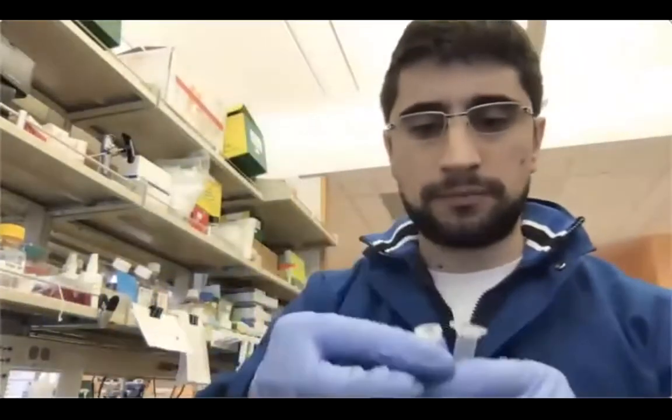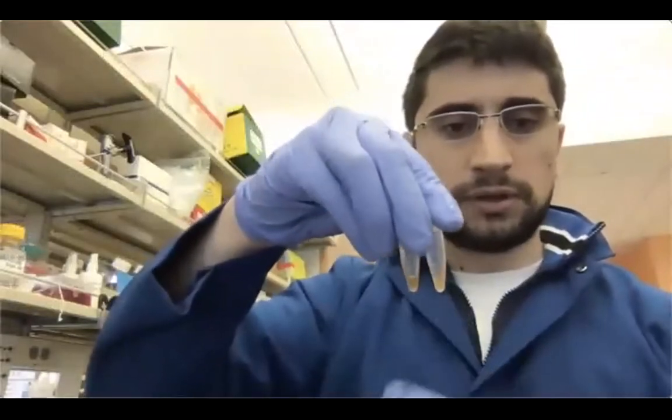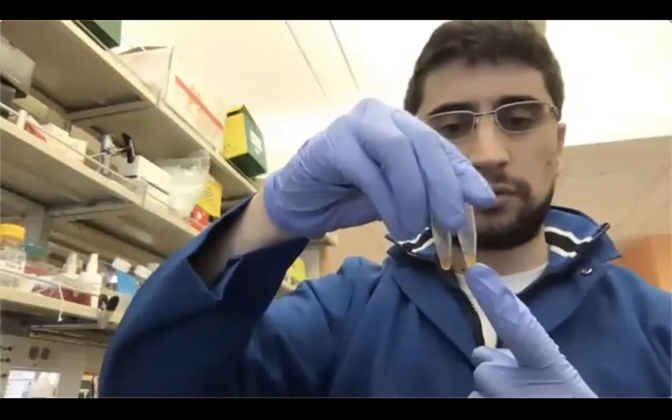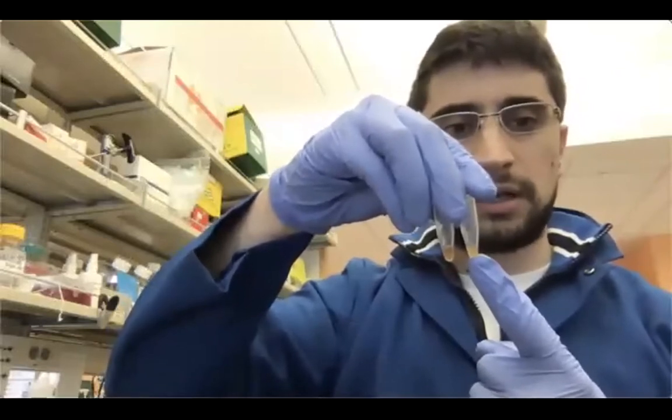All right, so as you can see here, sample 1, sample 2, there are two differences, the first being the volume. In this case, we have 40 plus 50, so around 90 microliters of AMPure beads plus our DNA library mix.